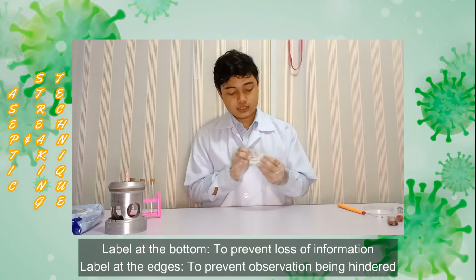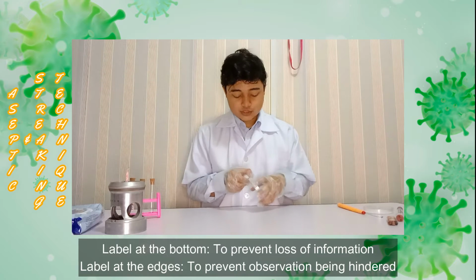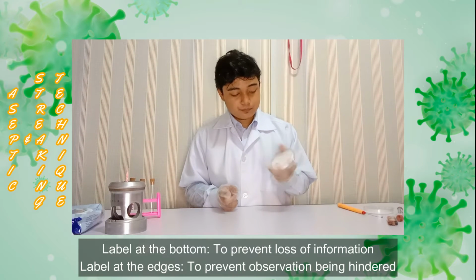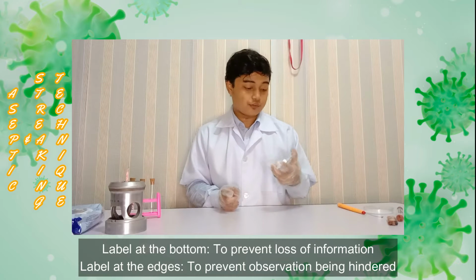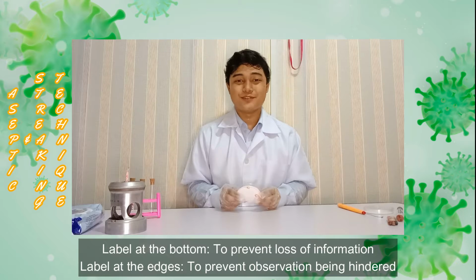So that's why we put the label at the bottom of the agar plate. The reason we write the label at the edge of the agar plate is to avoid interference with our observations.